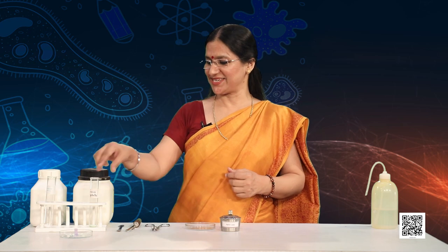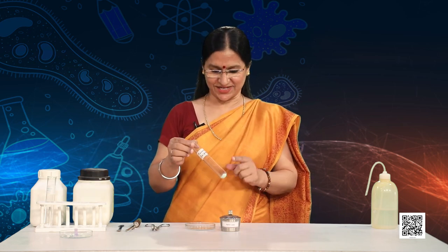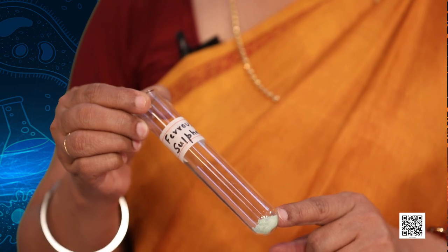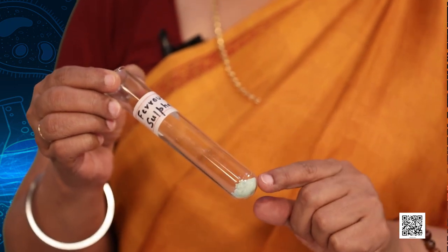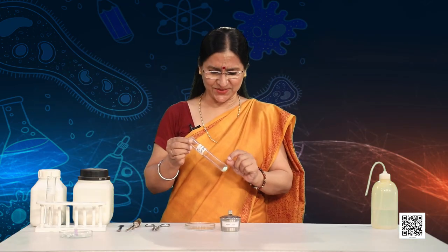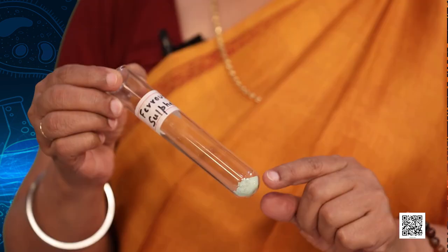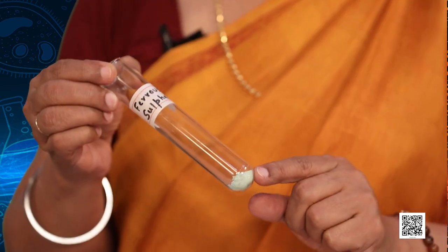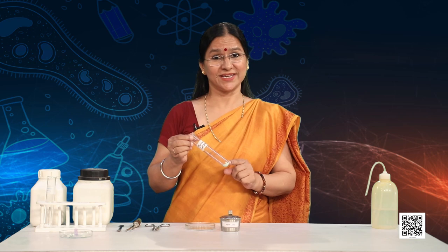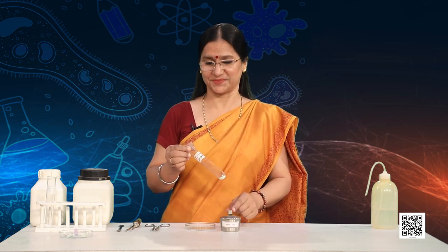As you can see in a boiling tube, I have taken 2 grams of ferrous sulphate crystals. Note the colour of the ferrous sulphate crystals — aren't they light green in colour? Now let's heat the boiling tube over the flame of a spirit lamp.